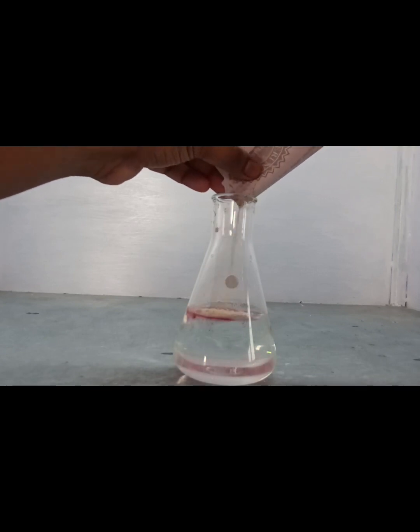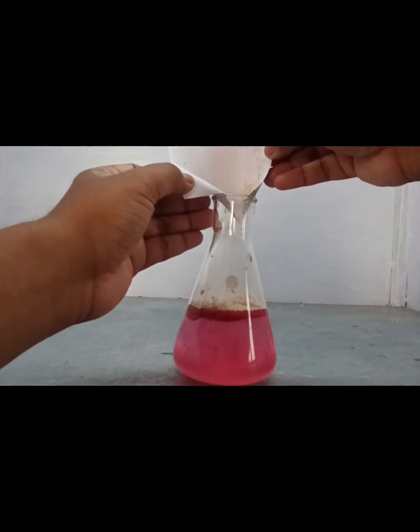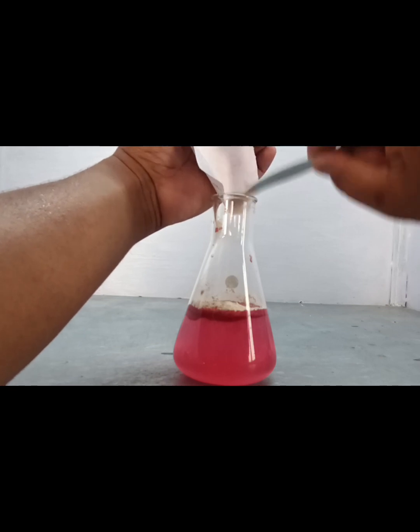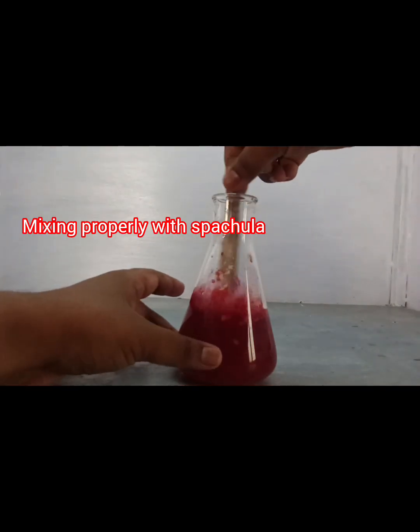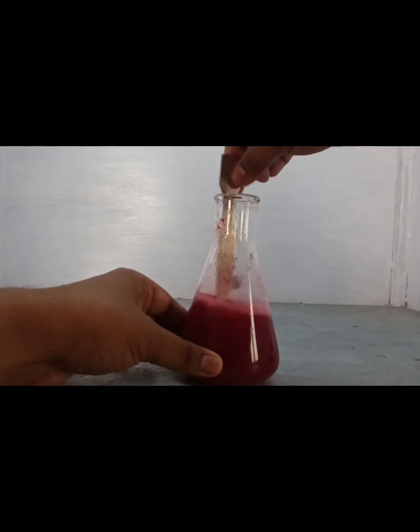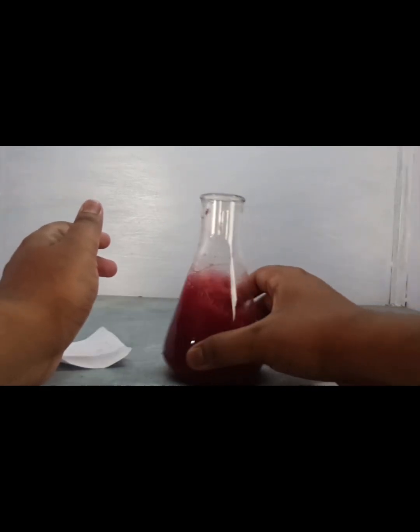After that, we have to pour the agar powder over the distilled water. Here we see a small amount of agar powder has mixed with the paper. After that, we clear as much as possible with a spatula, and then mix it properly with the spatula like this.